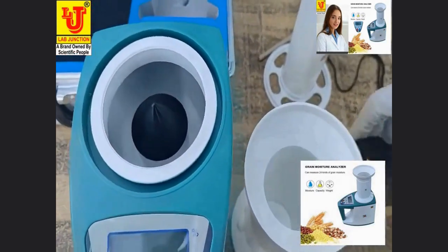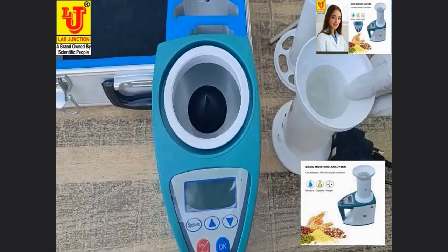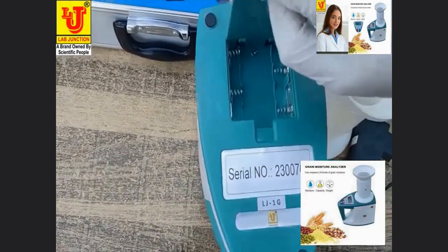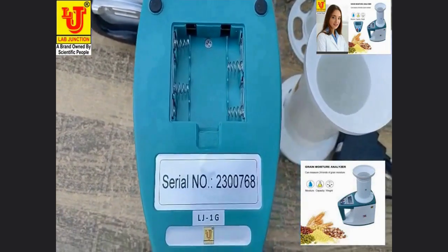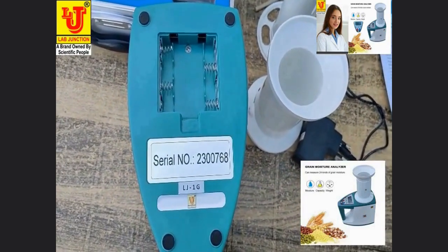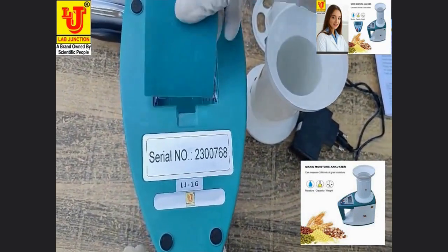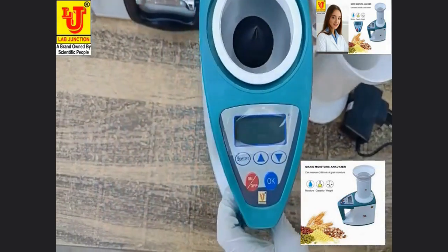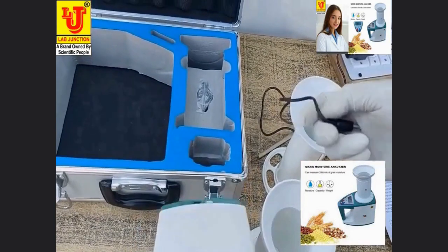One power adapter is included. You can also use this instrument with batteries — four triple-A batteries — or you can also use it with any 9-volt DC power supply. Now I am connecting the power adapter to the instrument.